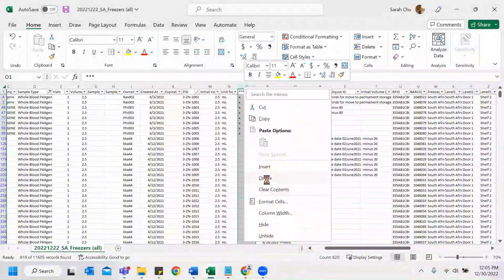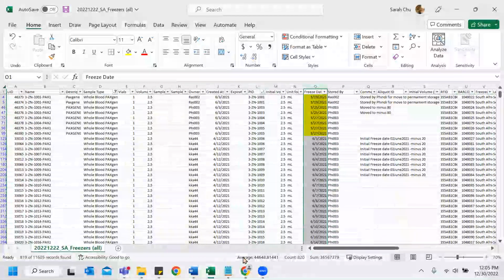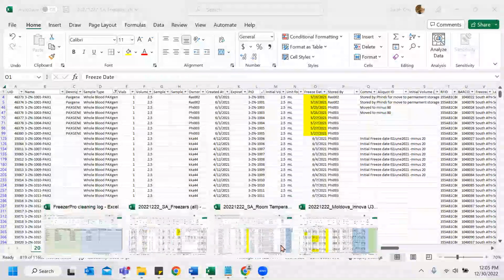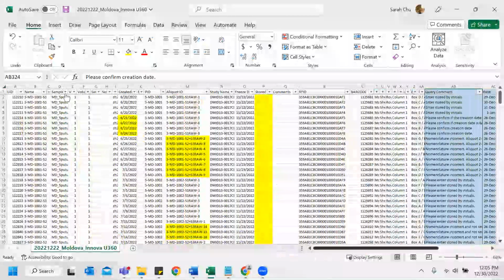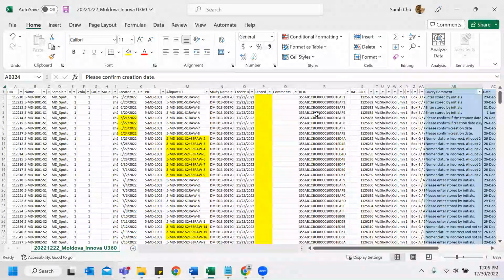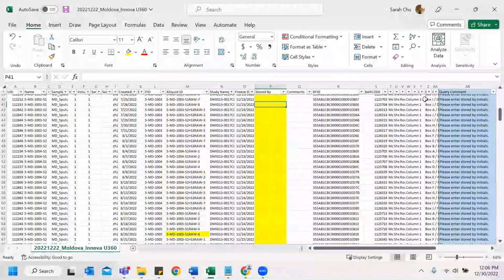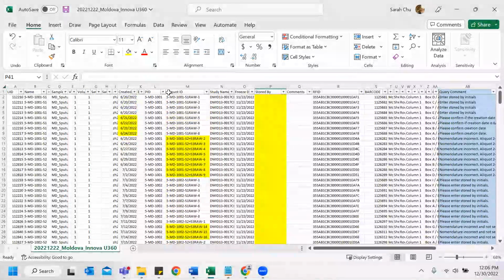Delete the column. So I'm just going to give other examples of data sets I've been working on. Moldova, for instance. In this situation, this file only has sputum raw compared to the other one, which had all the samples in the reports. You can see here, stored by initials are basically empty, which should be included, and with the naming structure as well, aliquot ID.